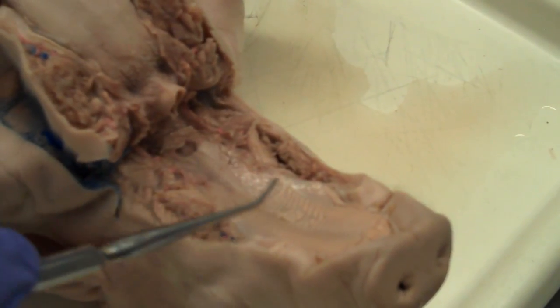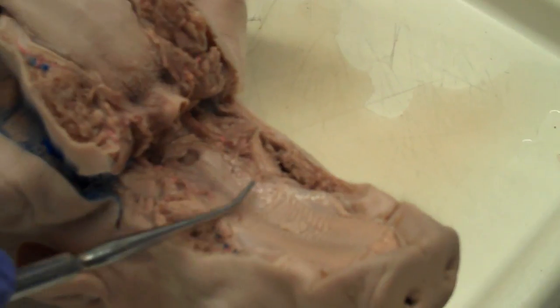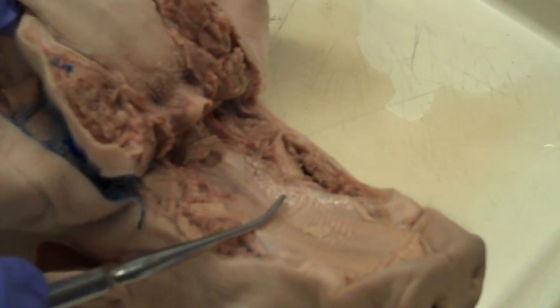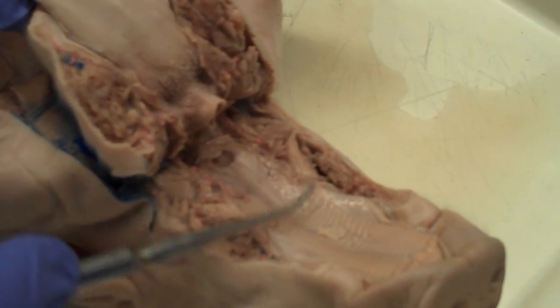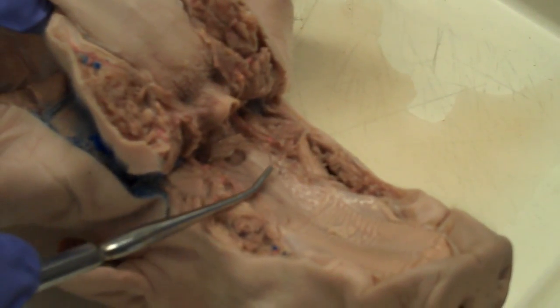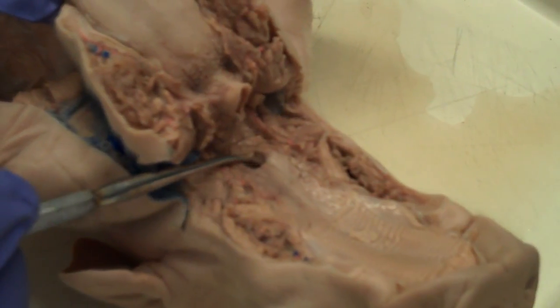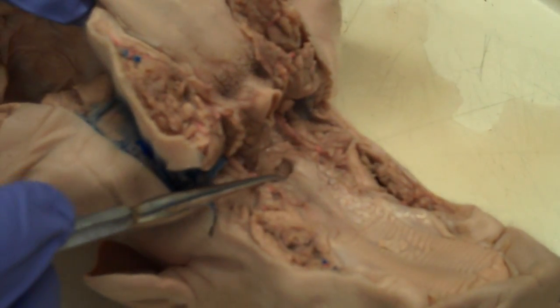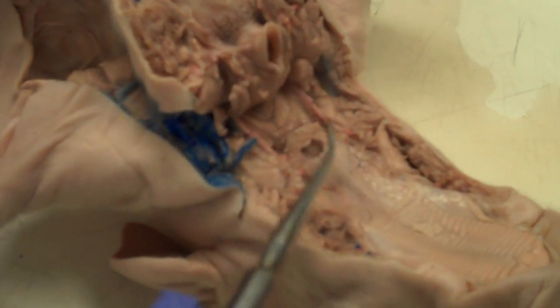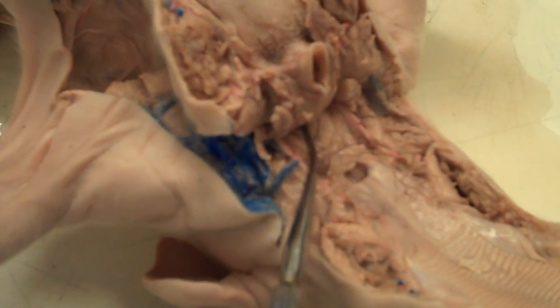Then you have the soft palate. This is the oral pharynx. You can see the entrance to the nasal pharynx and the entrance to the esophagus.